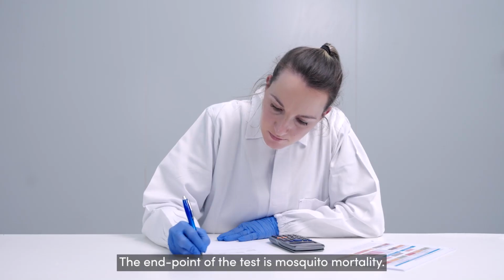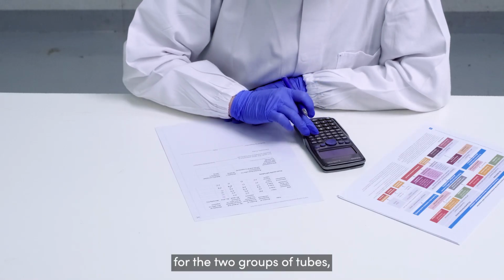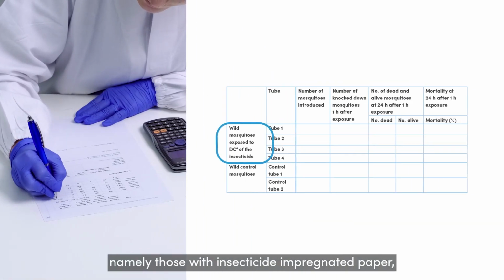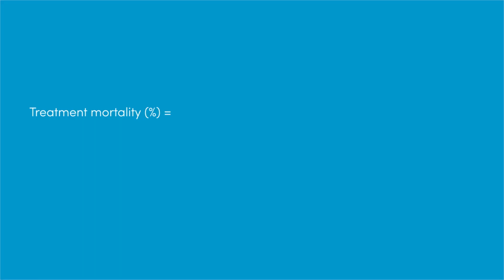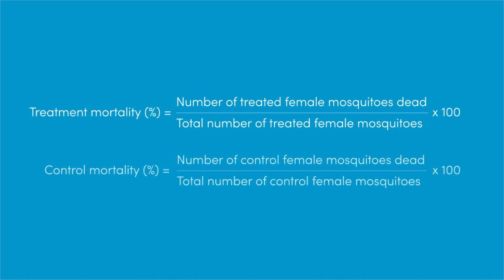The end point of the test is mosquito mortality. Mosquito mortalities should be calculated separately for the 2 groups of tubes, namely those with insecticide-impregnated paper, the treatment, and those treated with carrier oil or acetone, the control. Treatment mortality is calculated by summing the number of dead mosquitoes across all replicates with insecticide-impregnated papers and then expressing this as a percentage of the total number of alive mosquitoes in such replicates at the start of the exposure period. Mortality in the control is calculated in the same manner.